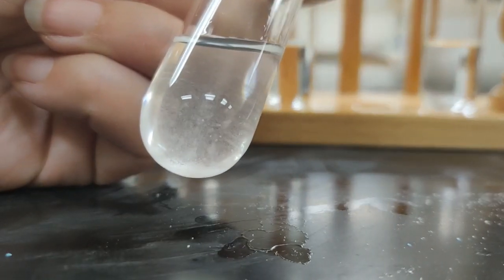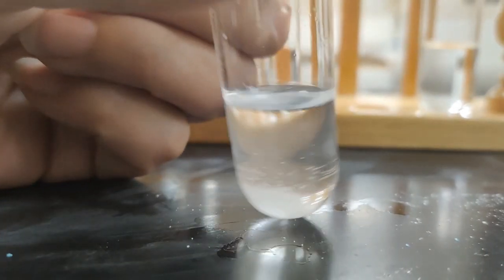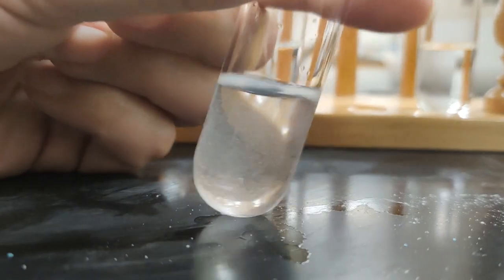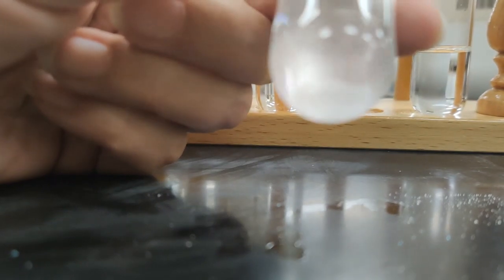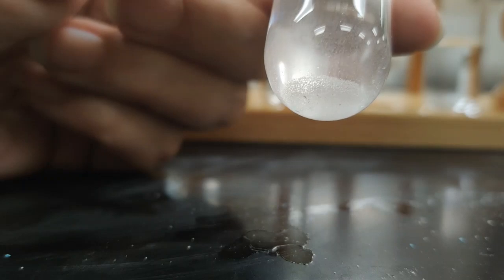Let's see again if I can tilt this up, if maybe we can see if there's any solid at the bottom. And yeah, when I put it down on the table, you can really see that solid chunk just sitting down there on the bottom. I can agitate it and swirl it around, but then it just seems like it's settling right back down as a chunk on the bottom. So I think we are going to say, yep, look at that. No dice on glucose. That is insoluble in hexane.